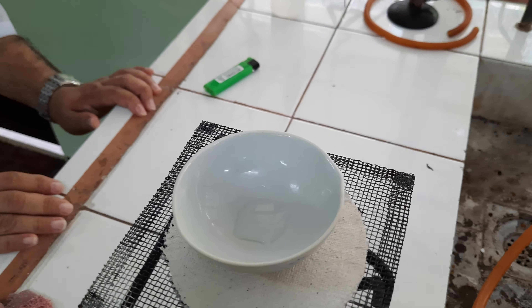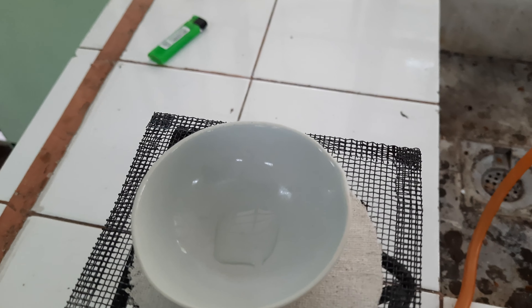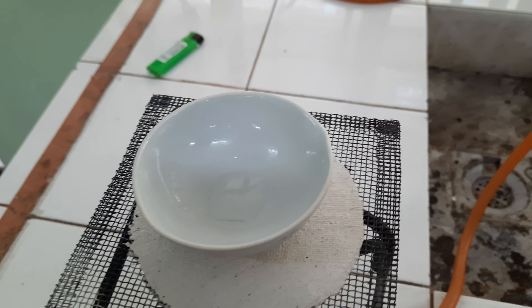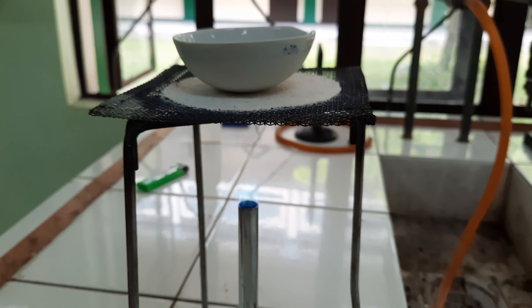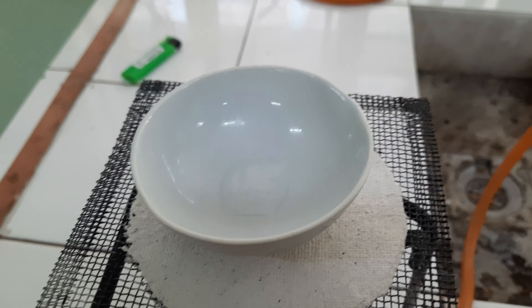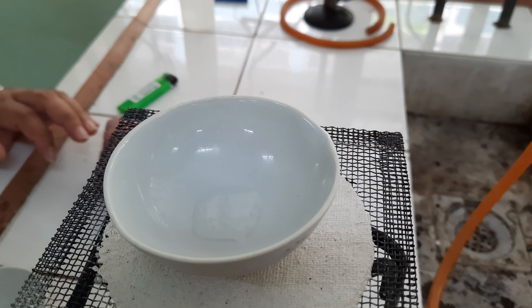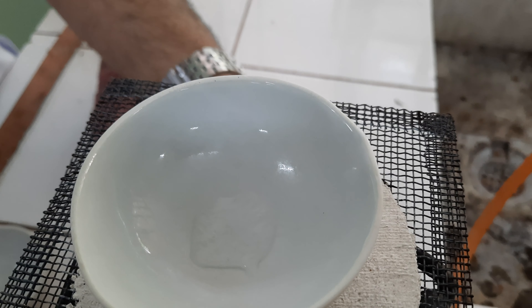Okay, so there's a little bit of water. What will happen to water as we continue the heating? Continue to take note and observe carefully what's happening to water as we continue the heating.